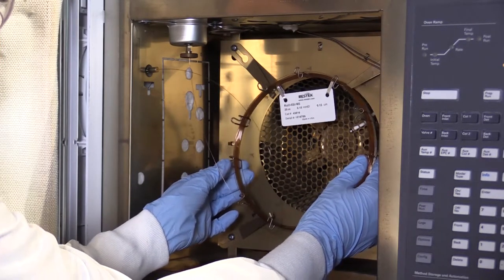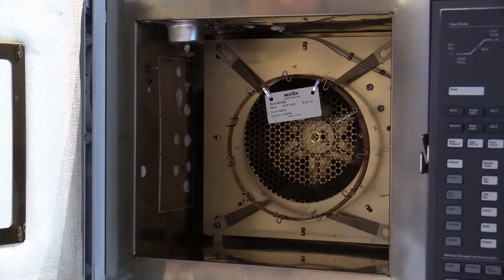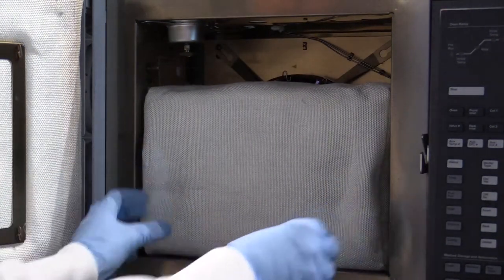Ensure the column and the column hanger are in the back position in the oven. Then, if no detector is in the front position, install the two block inserts in front of the column as shown.